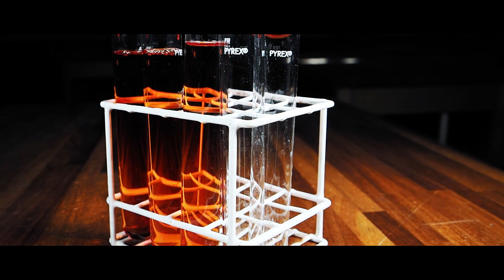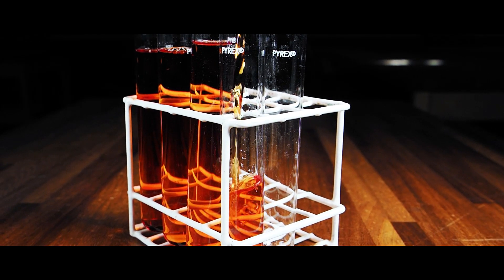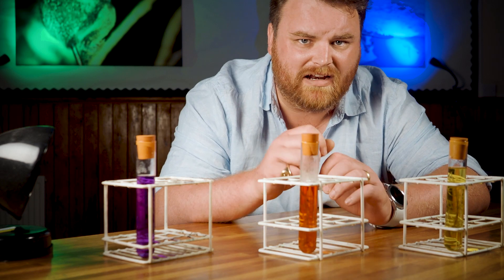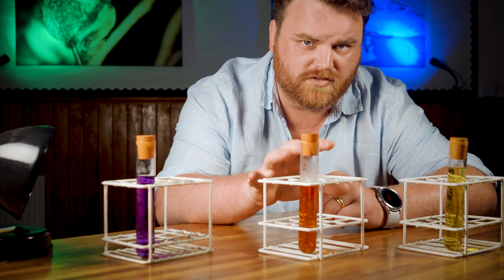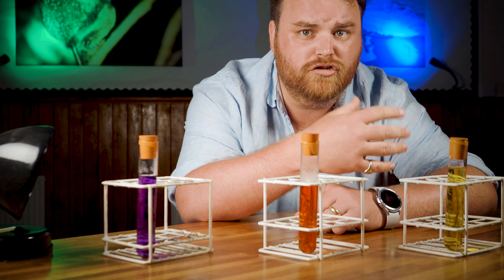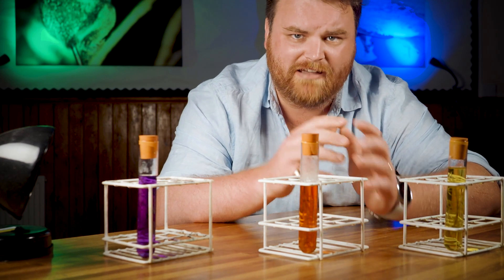Fourth up is another one in paper two this year: using hydrogen carbonate indicator to show net gas exchange in a plant. This is a really nifty little setup. It allows us to measure net gas exchange by looking at tiny changes in pH caused by changing concentrations of carbon dioxide dissolved in the water. At atmospheric concentrations, the indicator is red. But near the light source, lots of photosynthesis is taking place, using up the carbon dioxide and turning the indicator purple. At the other end, respiration has created more carbon dioxide than photosynthesis has used up, pushing the pH down a little and turning the indicator yellow. So the colour of the indicator can tell you where the balance lies between aerobic respiration and photosynthesis.